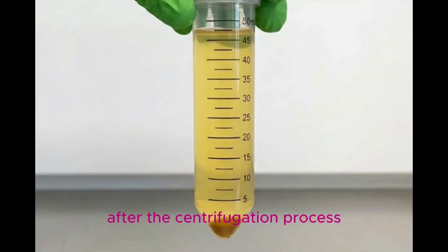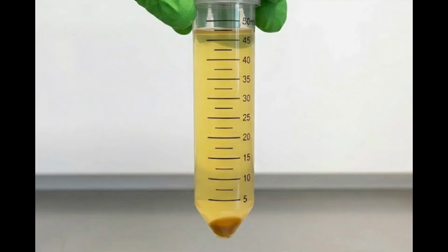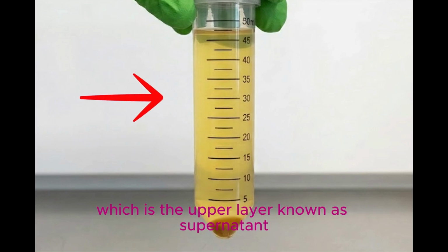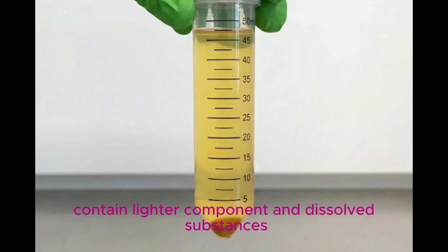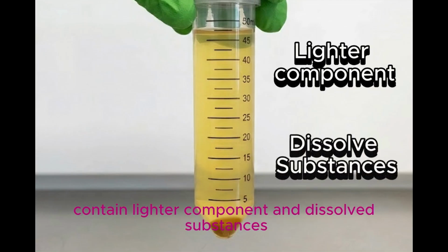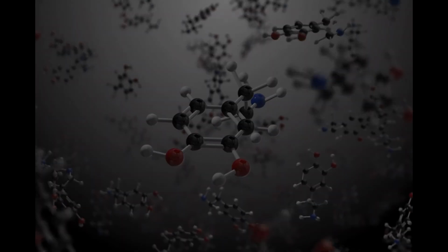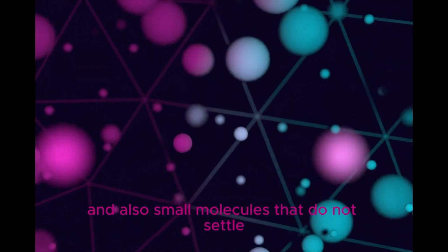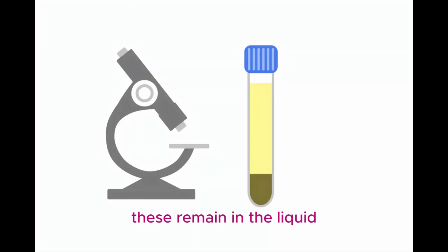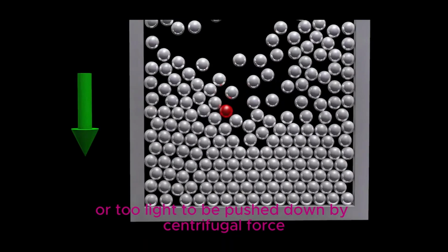After the centrifugation process, two distinct layers can be observed in the tube, which is the upper layer known as supernatant and lower layer known as pellet. Supernatant contains lighter components and dissolved substances such as water, urea and creatinine, dissolved salts and ions, and also small molecules that do not settle.